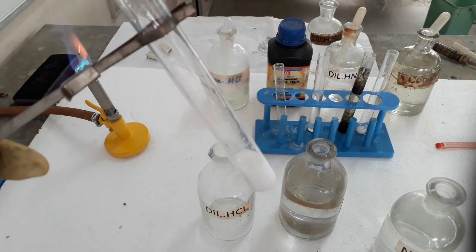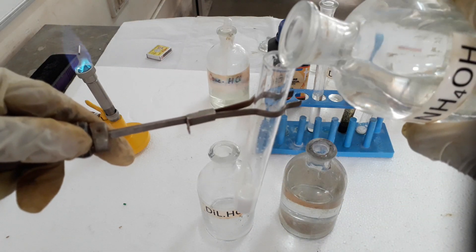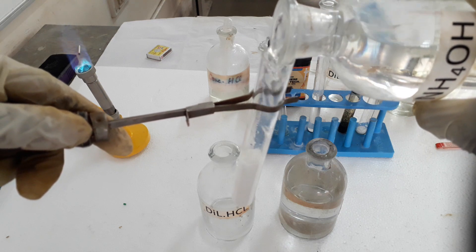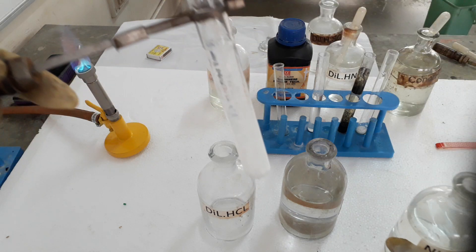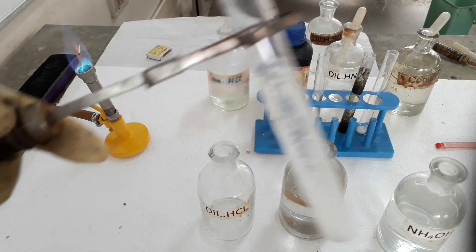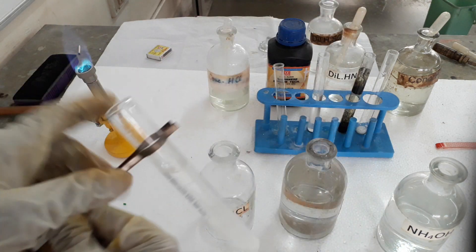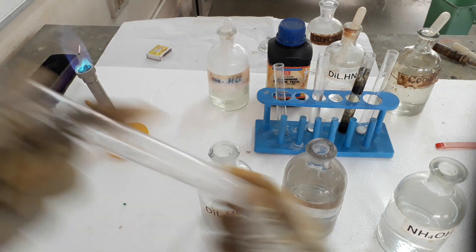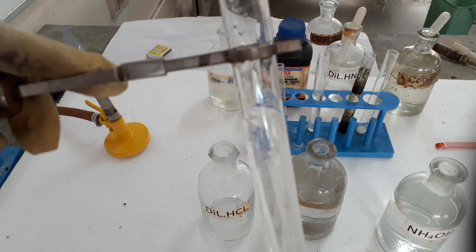Now on adding excess ammonium hydroxide to it, the curdy white precipitate dissolves forming a clear solution. See here, slowly it is forming a clear solution. Let us shake it — we will see that it gives us a clear solution.